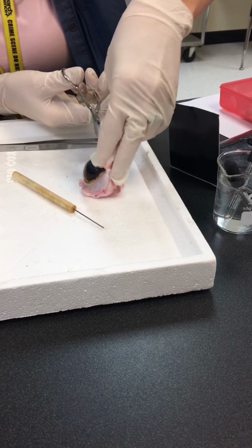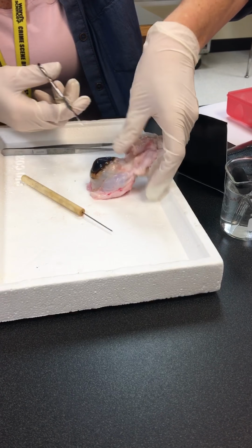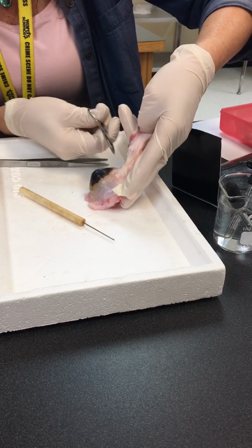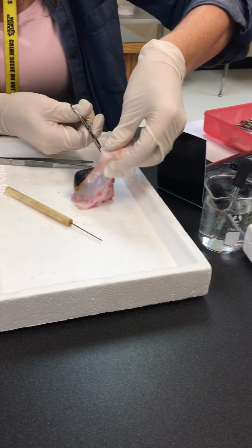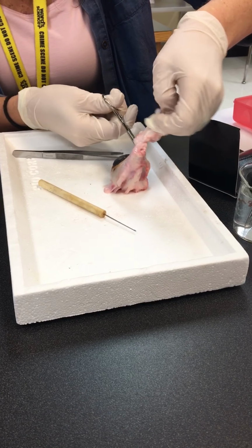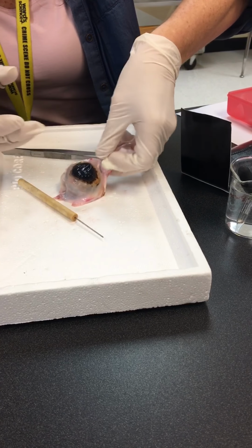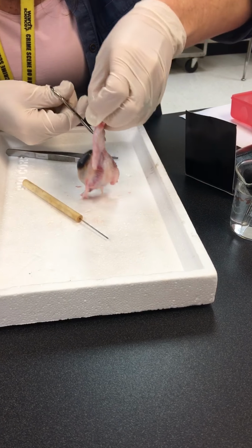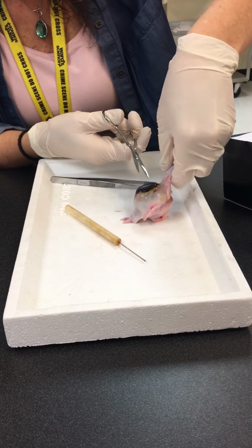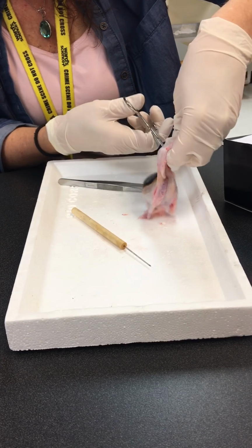Do we have all that tissue inside our eye? Yeah, you have all this tissue. This is the fatty tissue and connective tissue. It protects the eye, okay, and it's also the muscles as well, so it helps for movement. It just looks like trimming the fat.